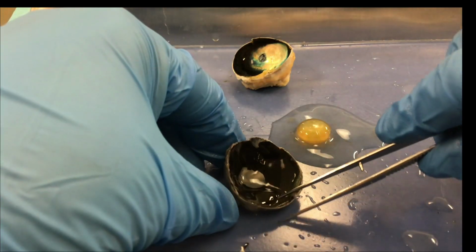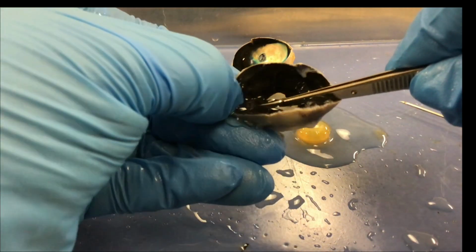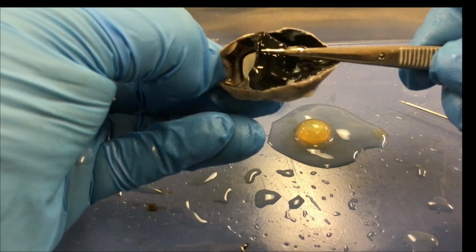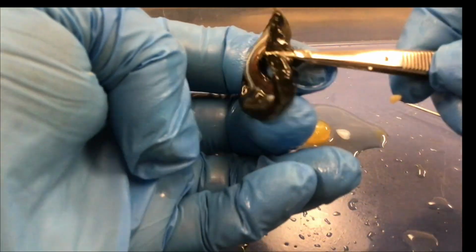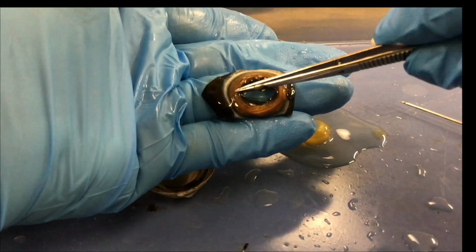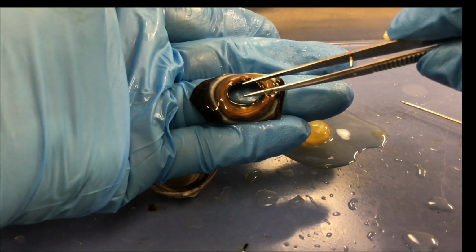Now what I'm going to do is pull this out so we can look at it from the anterior view, but outside of the cornea and the sclera. So I'm just sticking my forceps through the pupil, going towards the sclera and pinching it and pulling it up. So what I see here is, I'm going to flip it over, this is like looking at it from the anterior view. So I can see the hole, that's the pupil, and the brown is the iris, the intrinsic eye muscle that controls the size of the pupil.